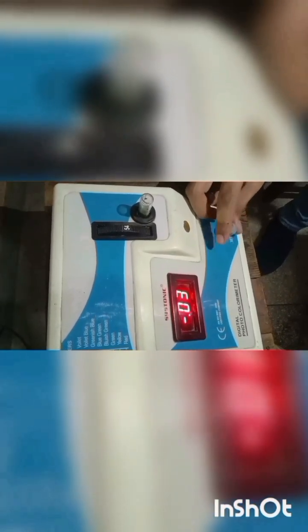Now we have to auto-set the value to 0 on the colorimeter by placing this distilled water in a cuvette and noting its absorbance. We will standardize our colorimeter by setting the value to 0.0, keeping the blank solution of distilled water in the cuvette.